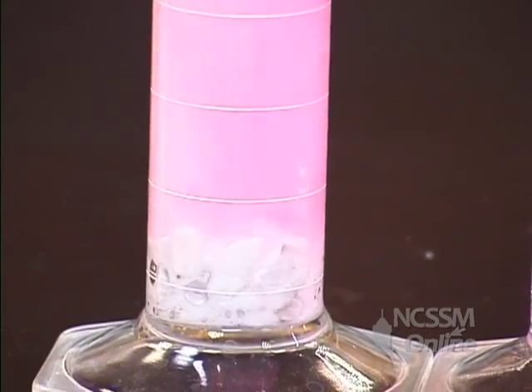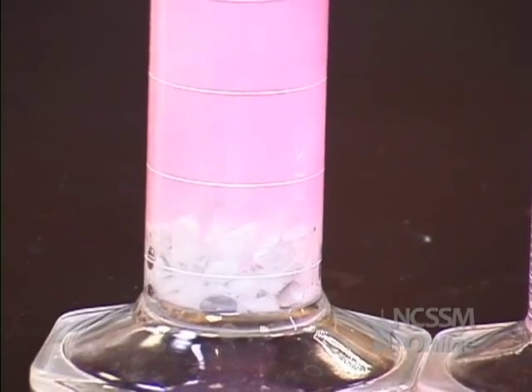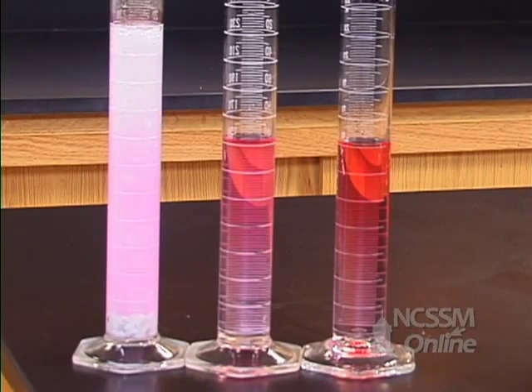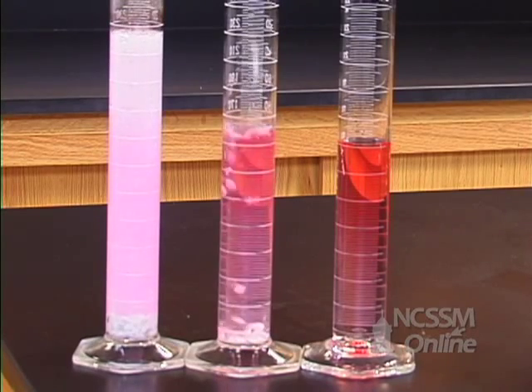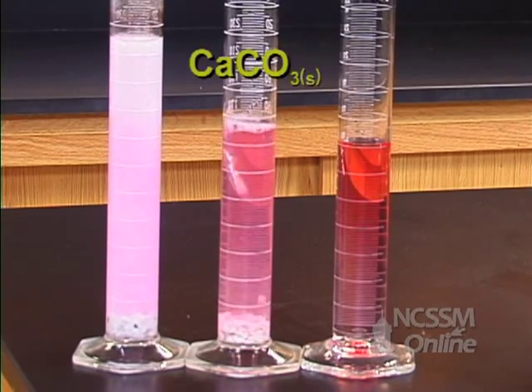We see a very rapid evolution of carbon dioxide gas from the cylinder containing the hydrochloric acid. The strong acid solution has a high concentration of hydrogen ions.